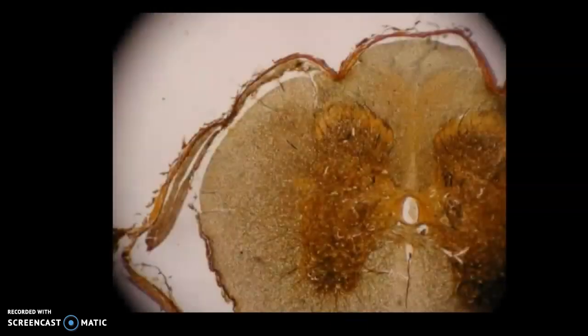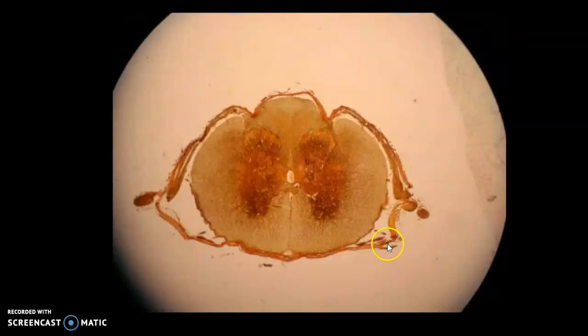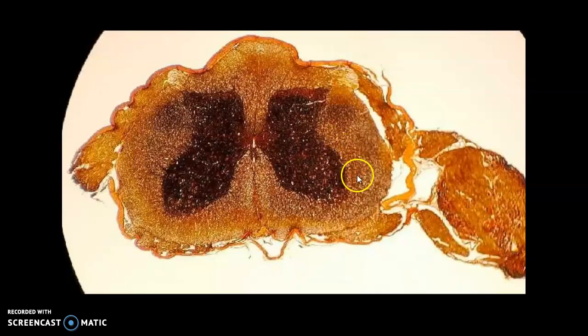More ganglia. Here, there's an anterior median fissure. So you can see different views as well. This one we have an anterior and posterior root. It's probably thoracic. I don't see any lumbar section right there. But I want you to draw the first one because it's the prototypical. I have a lateral horn. I have an anterior horn. I have a beautiful ganglia.